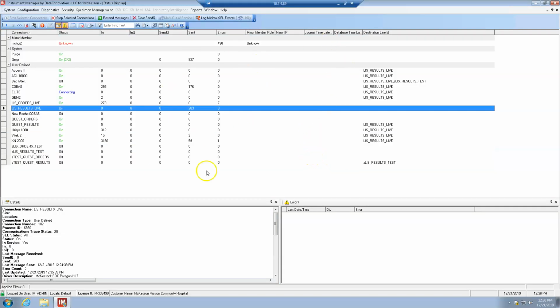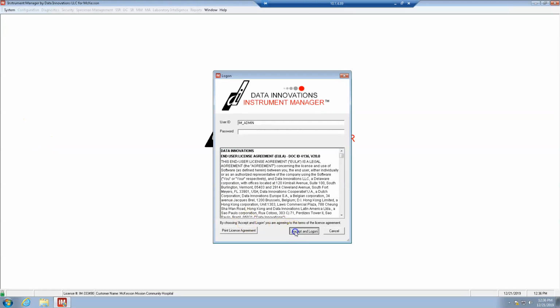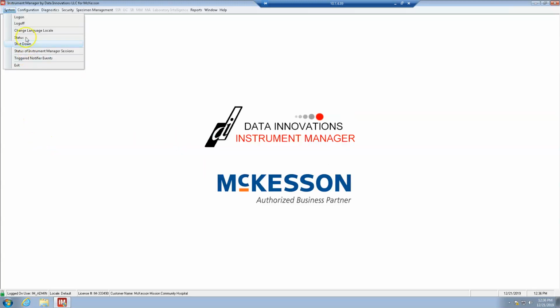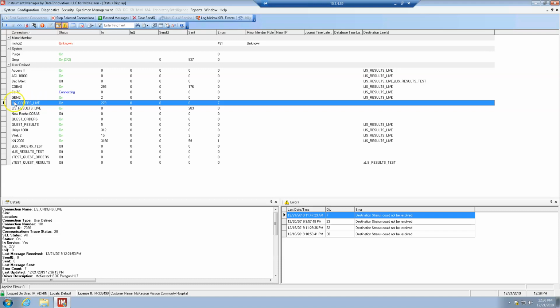Okay. So this here is the DI. More frequently you'll log into a screen that looks like this. So the next step is to see if the interfaces on the DI are working properly. So we're going to open up the instrument manager, system status. Okay, so we're going to look at this interface here.